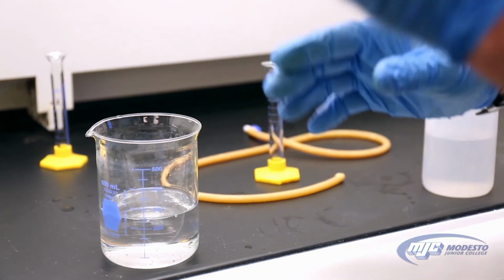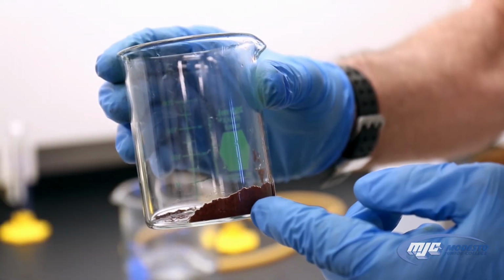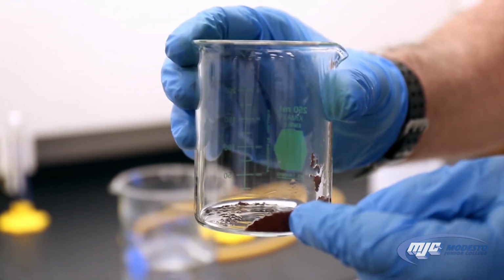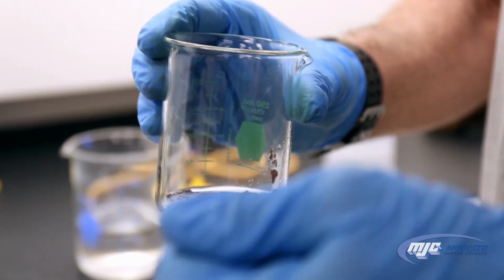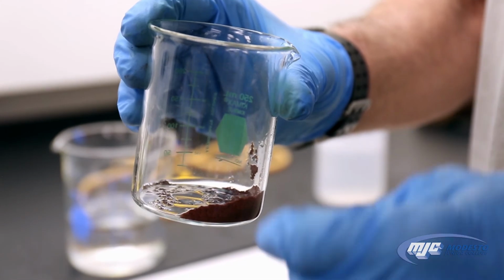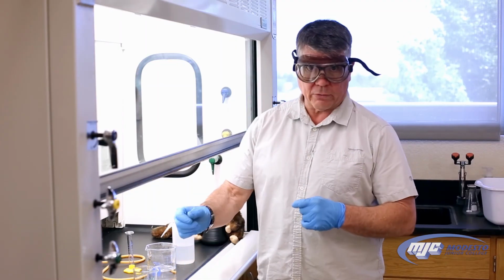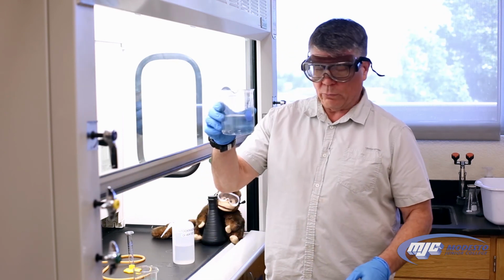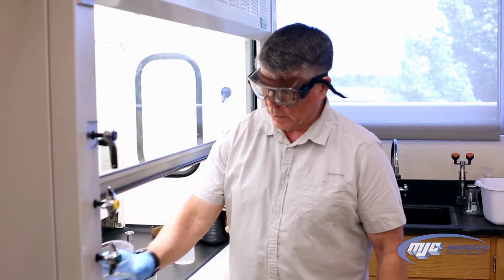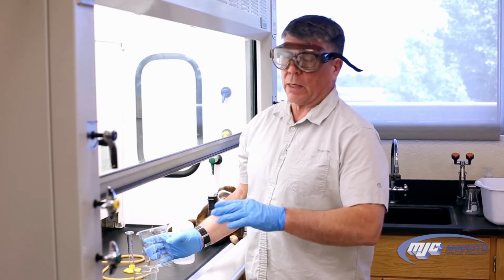Okay, so now we have wet copper here. We have one more thing to do. By the way, that copper right there is the same exact atoms of copper as we started with, that shiny copper metal that we weighed out in the beginning, exact same atoms. So now what we need to do is rinse it with some acetone. I'll tell you why in just a second, but first I need to dump this waste, which is just water, down the drain. Because the acetone waste we cannot dump down the drain.